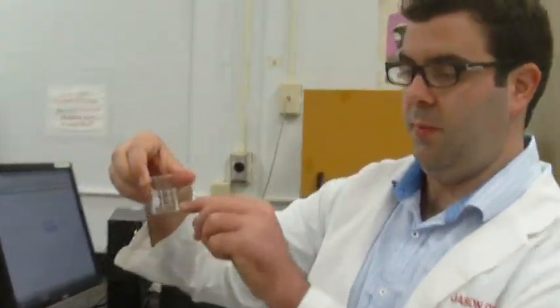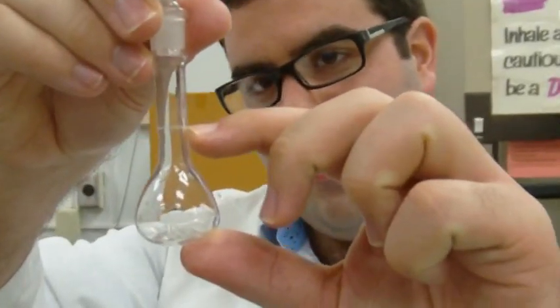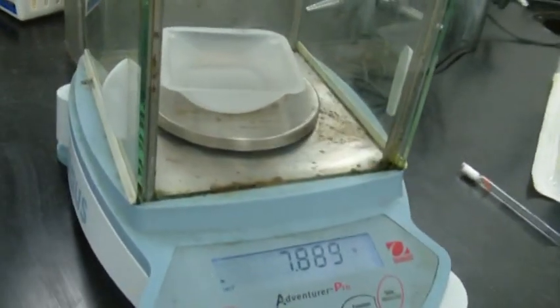The beaker, just measure up to that line right there. But the volumetric flask, this will only measure out 10 milliliters. See this line right there? That is the 10 milliliter mark. So at that mark, it is exactly 10 milliliters. Excellent. Okay, so you're going to do that 4 times each, and same process, right? Right. You weigh it out, and based on the mass, you're going to determine what volume you actually measured out. Correct. All right, we'll come back when you're done then.